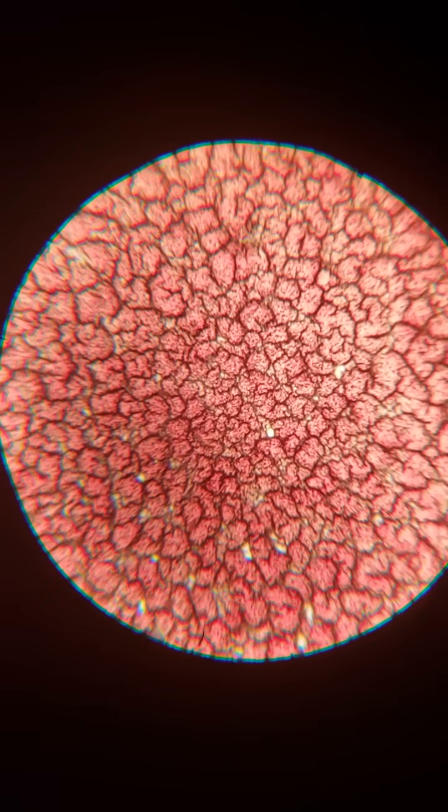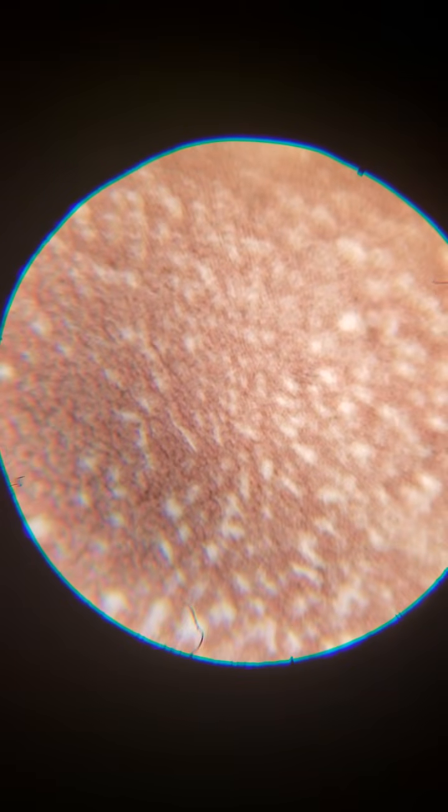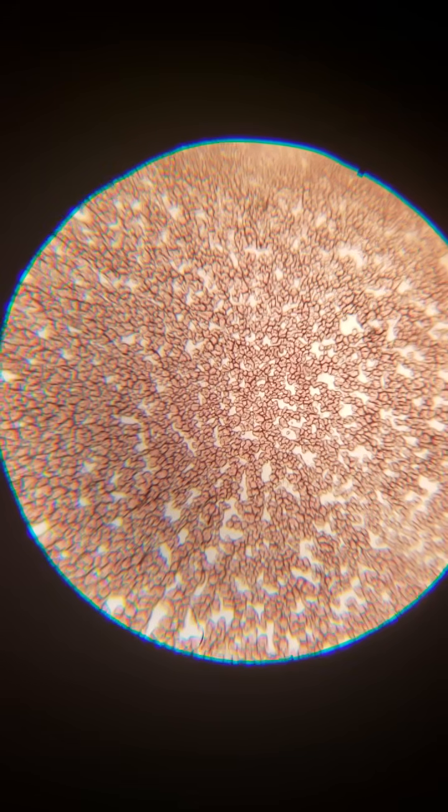Those are cells that are hardening, and they're all little circles, and as we get to the outside of this, you can actually see all the little circular disc cells. And as we zoom in all the way, you can see that that pattern is made up of what look like little coins stacked on top of each other.